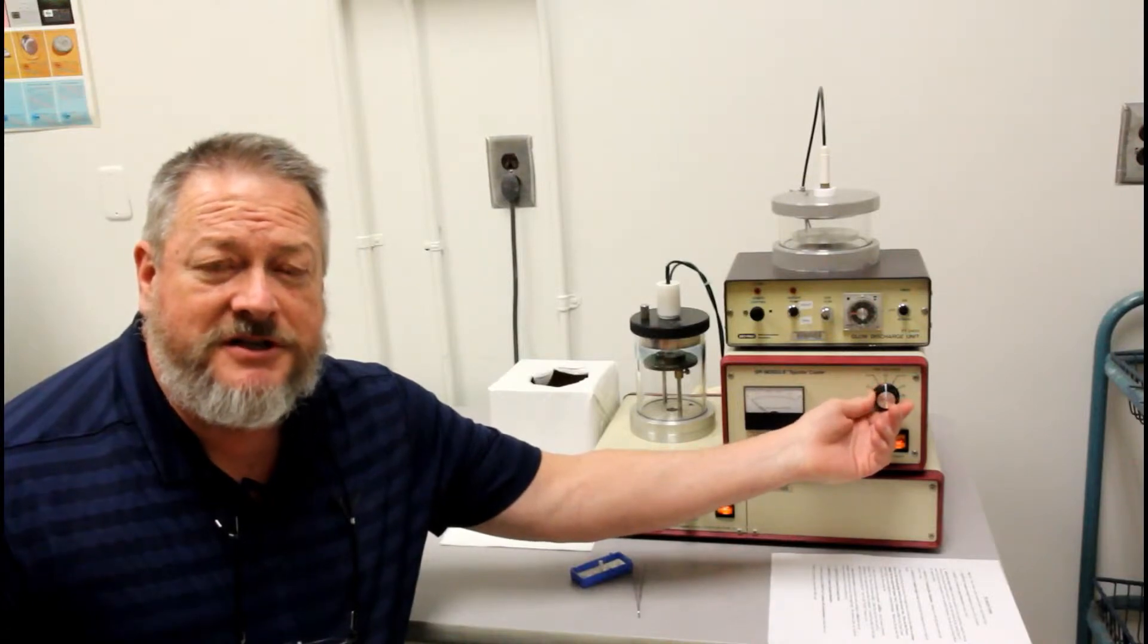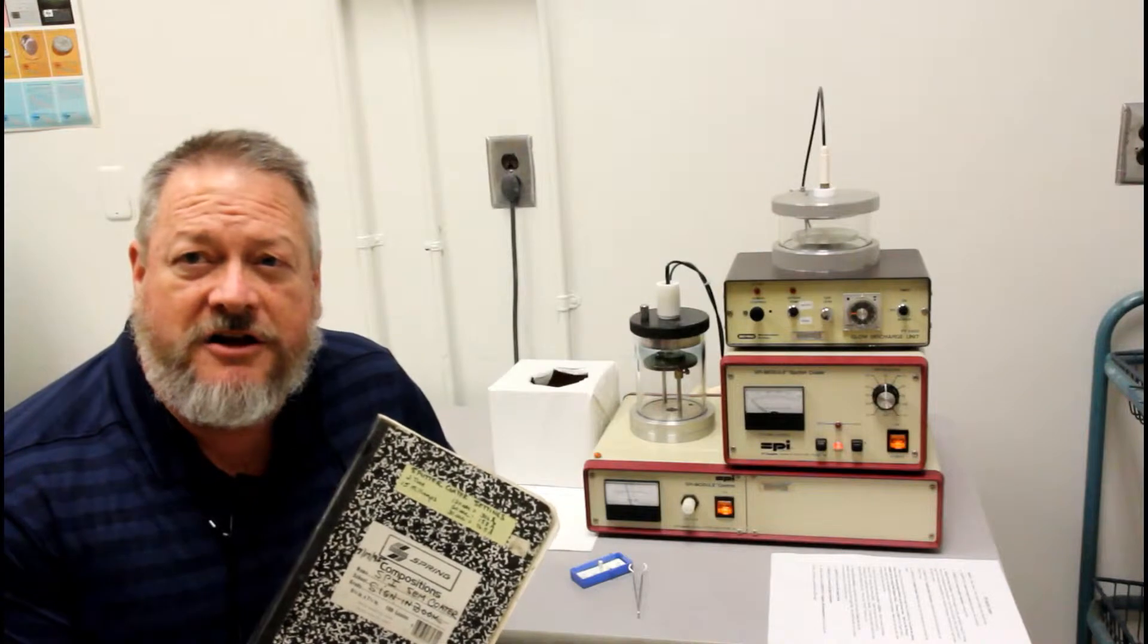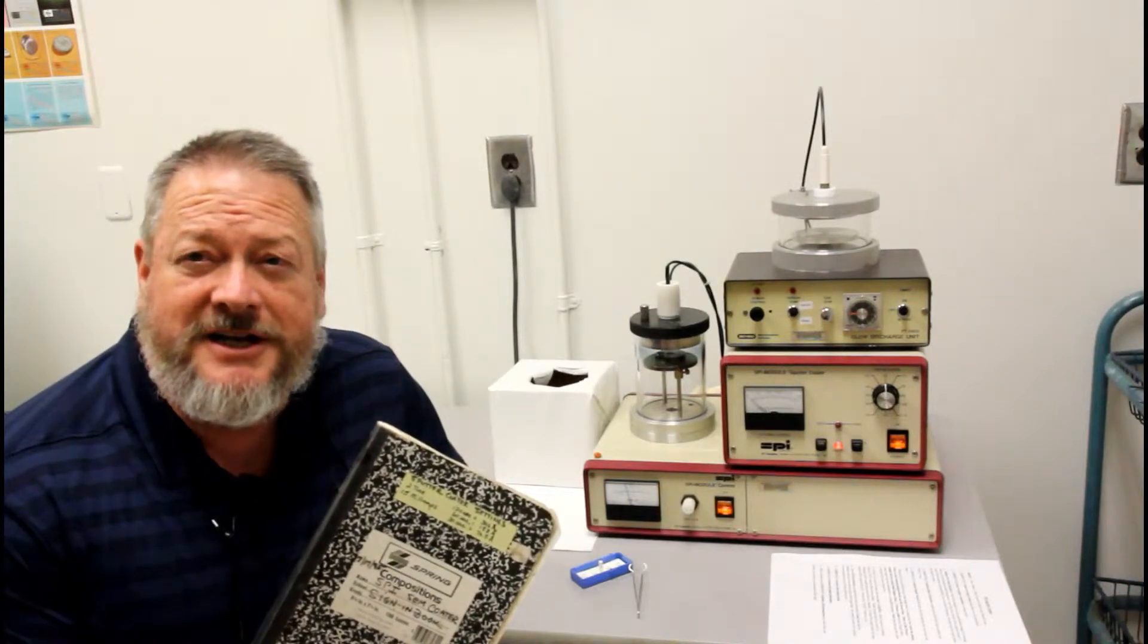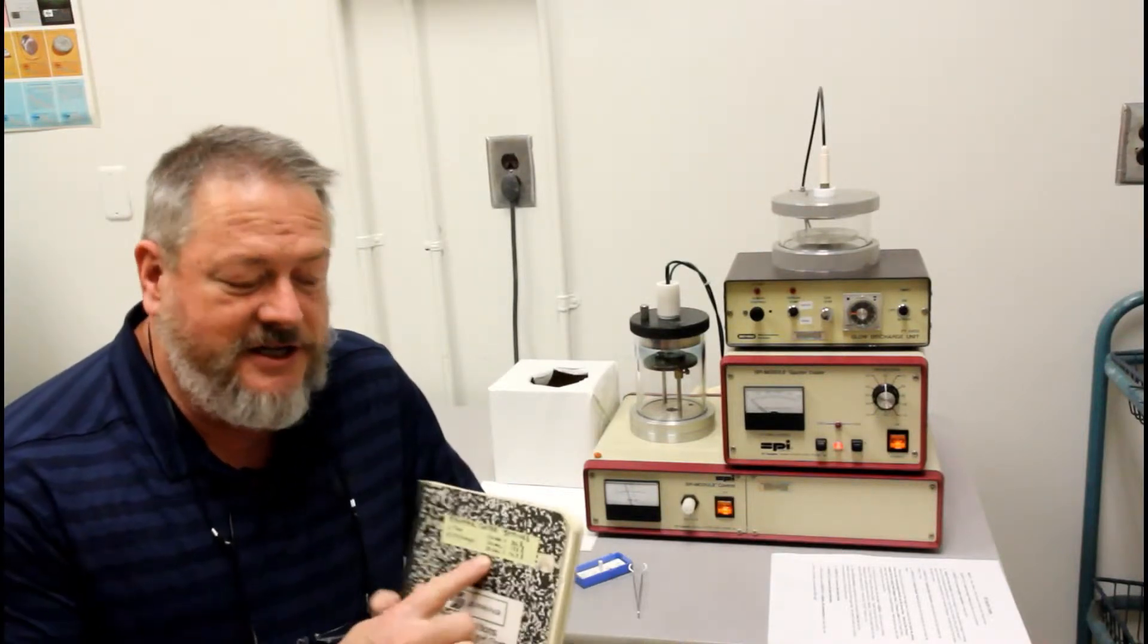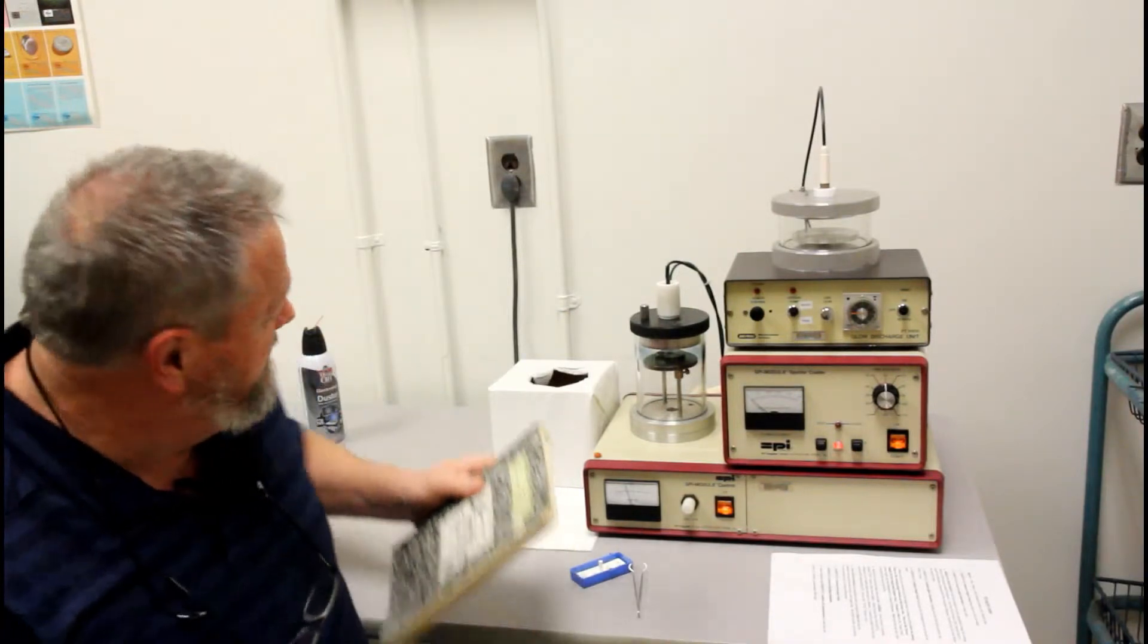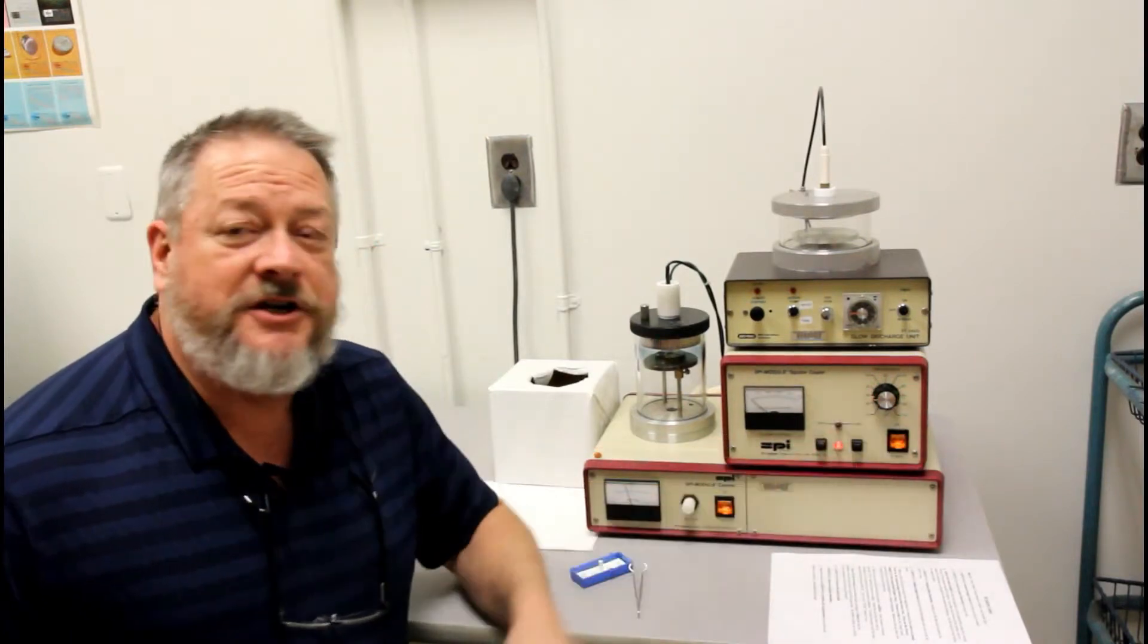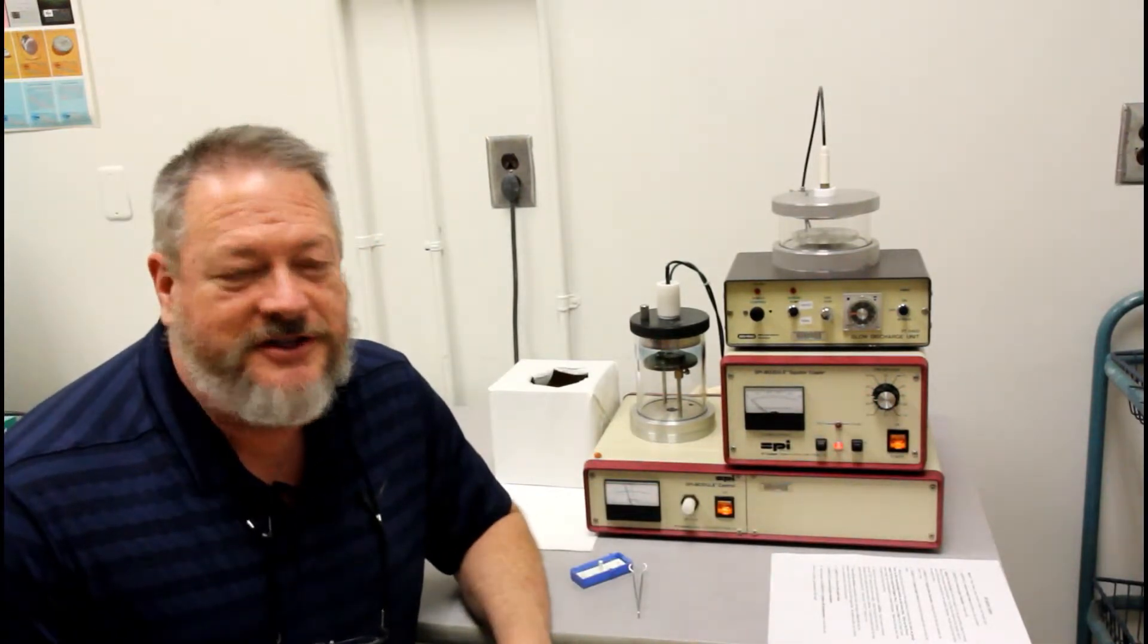Now the amount of time corresponds roughly to the thickness. On our log book, which you would sign in and write down what you're doing, there is a chart that tells you what thickness for what time. For now we're going to do 30 seconds, so we don't have to wait too long on the video.